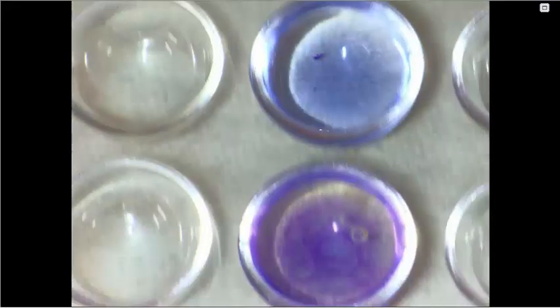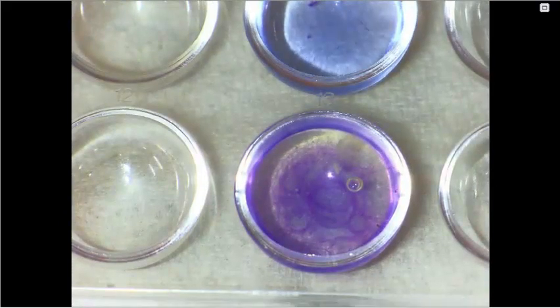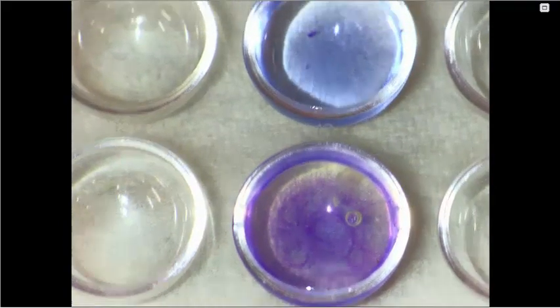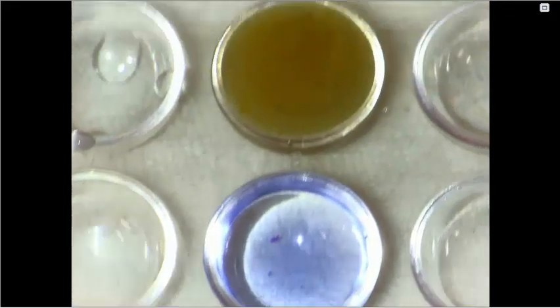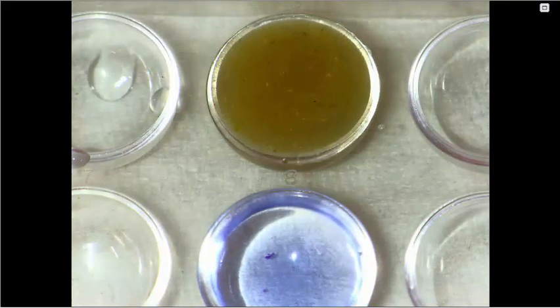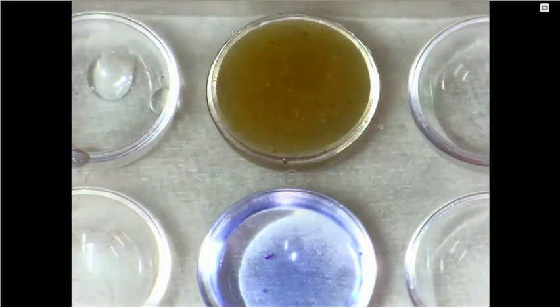So remember, a positive is the egg white, where it turned purple. A negative is the distilled water, where it turned blue. And I'd say that this McMush solution is inconclusive. We cannot definitively say yes or no to the protein in that particular scenario.